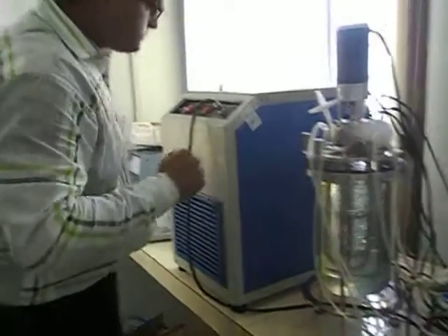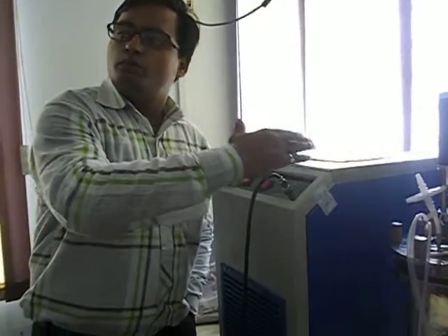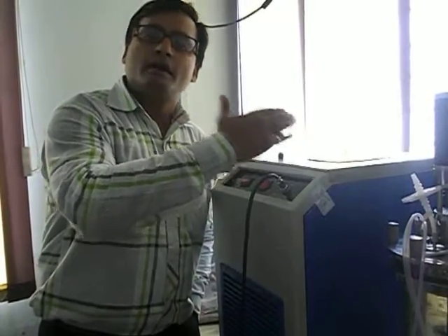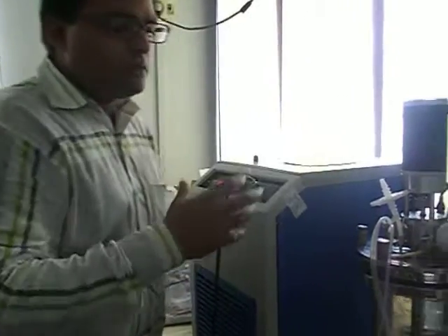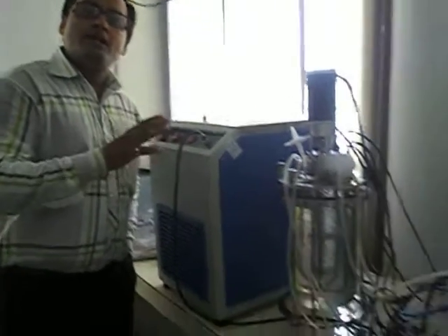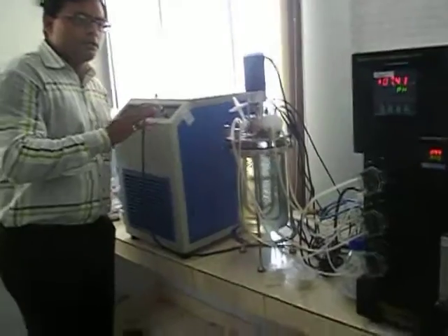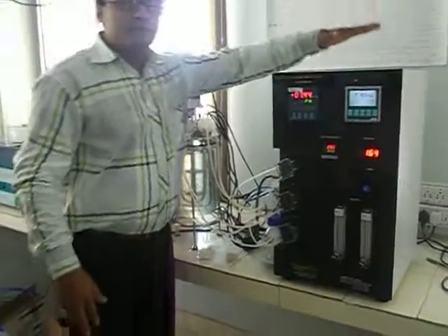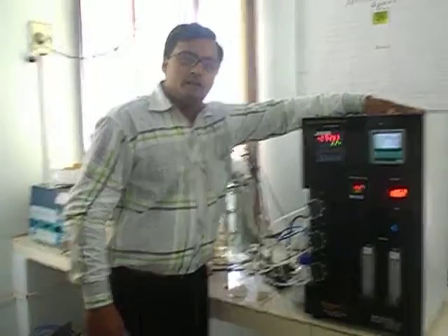We have a chiller for low ambient temperature — if you want to work at low ambient temperature. These are all the features. You can call this a fermenter, or you can say a bioreactor. We are the manufacturer of bioreactors.